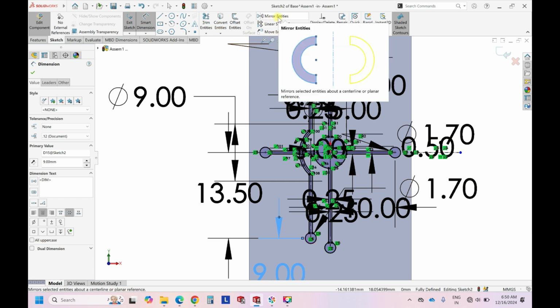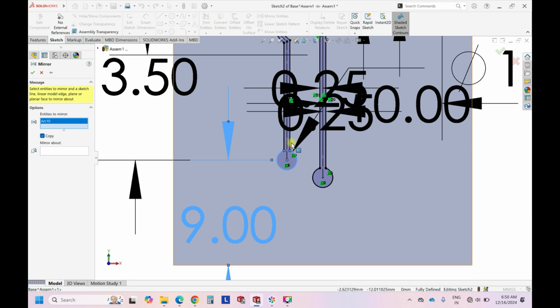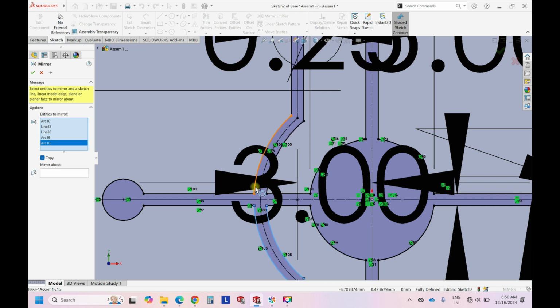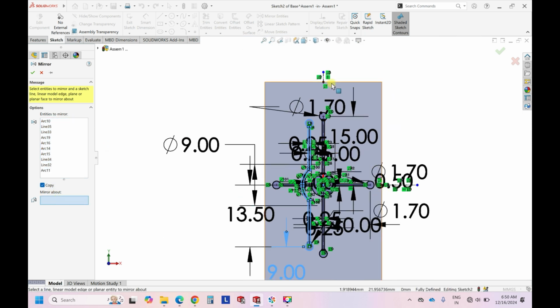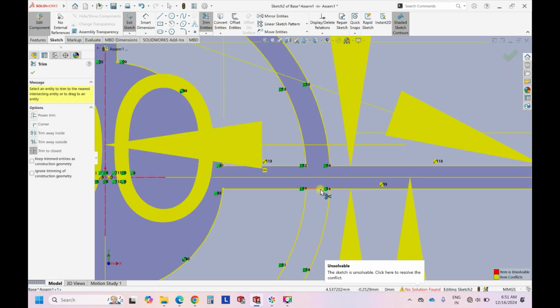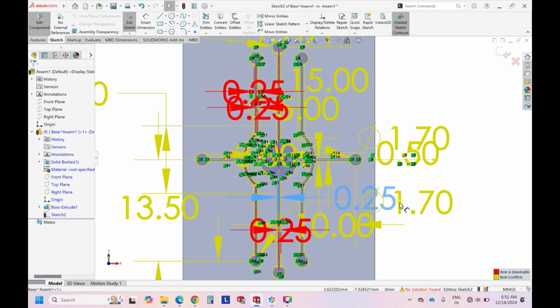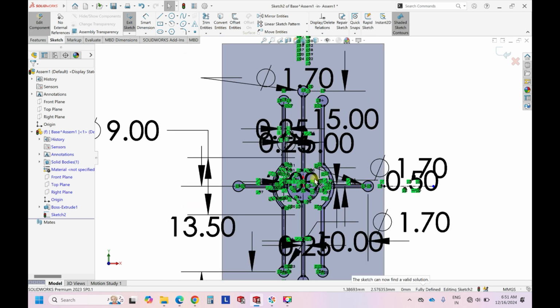So simple way, just use the mirror entities. So you can choose, okay, and then copy over the center line. So now this is ready, and then after that we can just trim these two portions. Okay, if you see that this is giving this kind of error, because it is over dimensioned, so we can try to delete one of these, so it is fine. Anyone, if you delete the red thing, it will become fine.